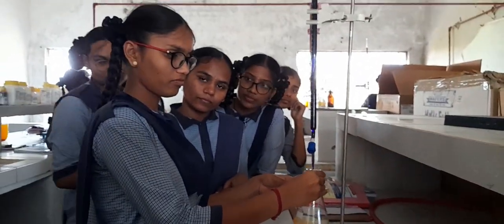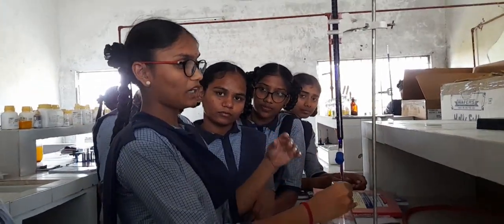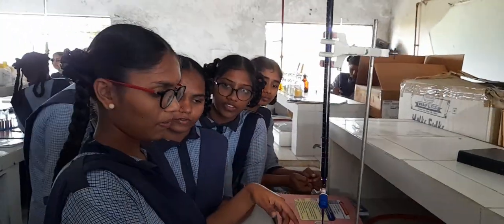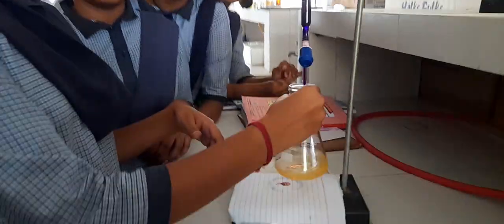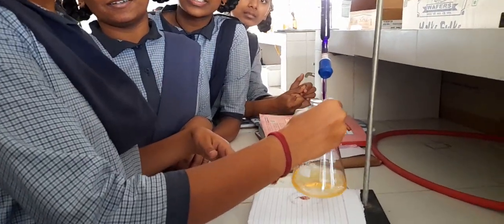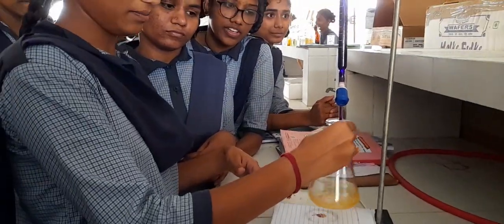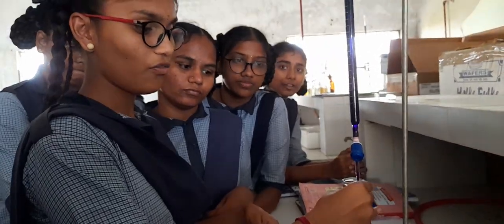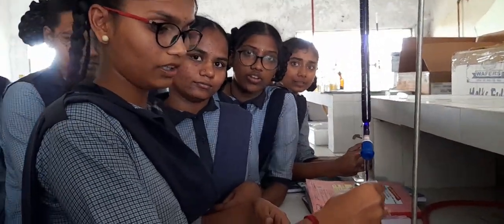Yes, Nana, how is your practical going on? Sharanya, potassium permanganate, you have taken in a burette. Yes, ma'am. So what did you take in your conical flask? Previously it was oxalic acid. Now it is ferrous ammonium sulfate. It is also called Mohr's salt.